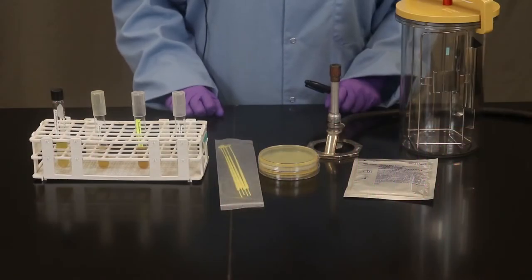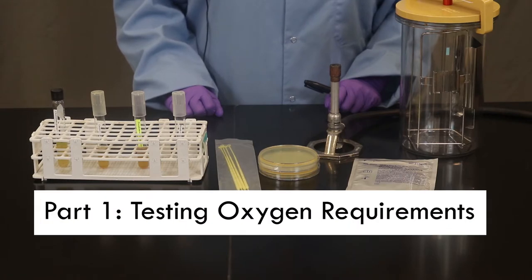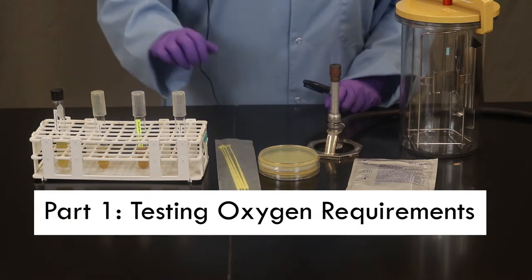Welcome to Bio 205 Microbiology at Pima Community College. In this video we're going to show you how to test the oxygen requirements of four different bacterial organisms.